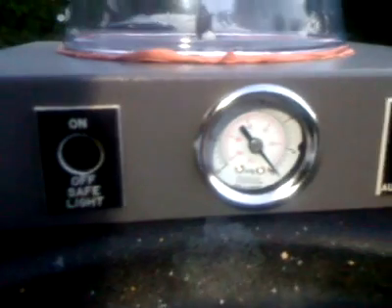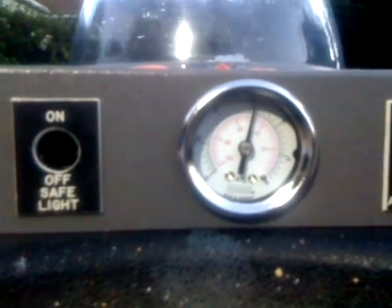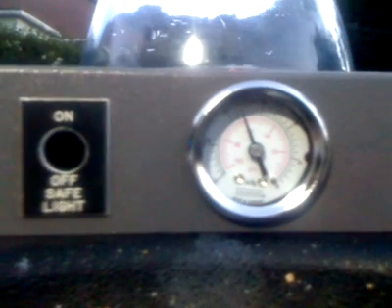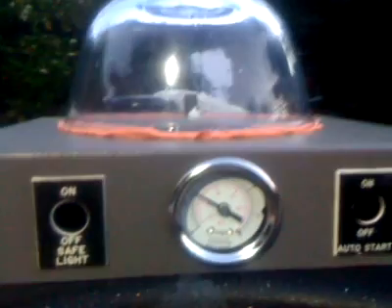Right. So I'm just going to push this down now and wait until it seals. Pushy push, I can hear it burbling some air bubbles in. And there it goes. Right, that's sealed down. And that's minus 10 inches, minus 15 inches, coming up to minus 20 inches mercury. It's so slow. Just kidding.